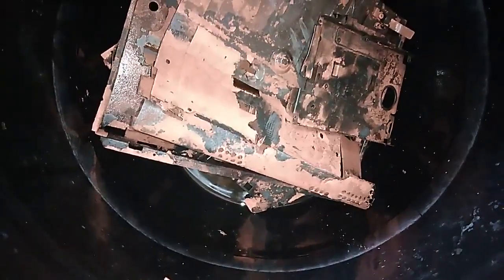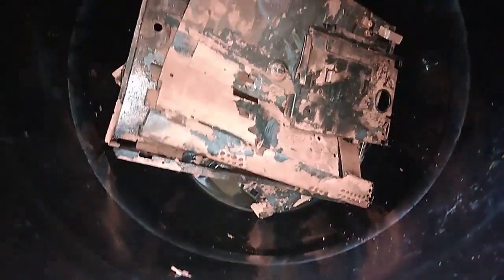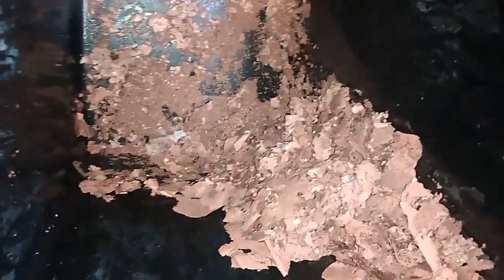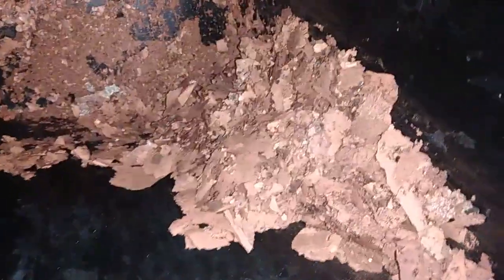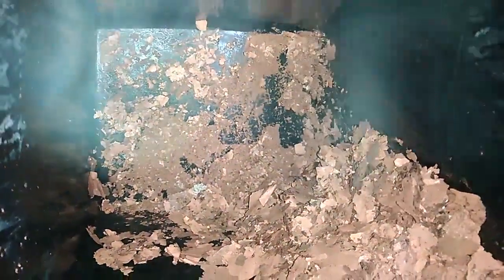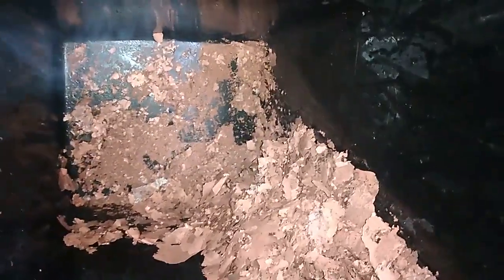The barrel is clean and the metal is clean, so right now I'll add new saturated acid for cementation. After three or four washes with hot water, this copper is clean — no acid. I'll collect it in a metal dish, put it on the fire to remove water, and collect it in a glass jar to keep for melting.